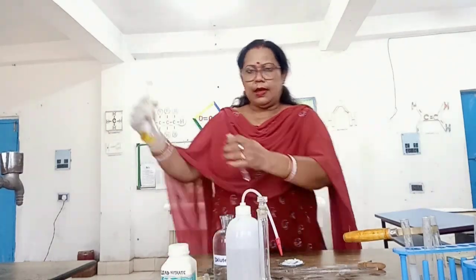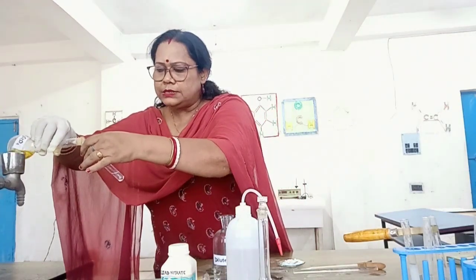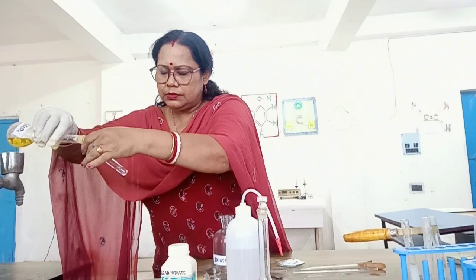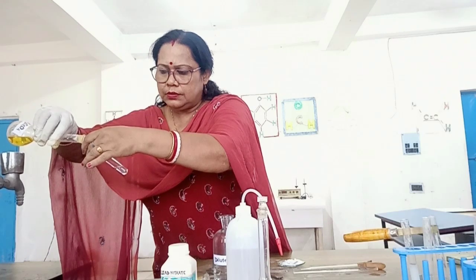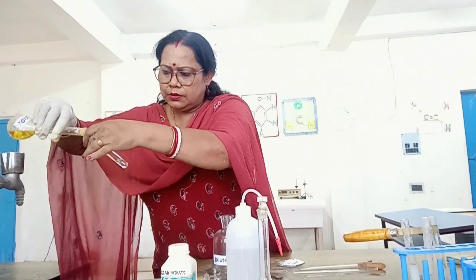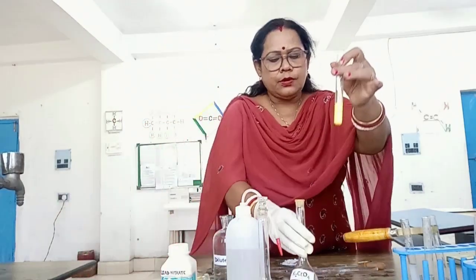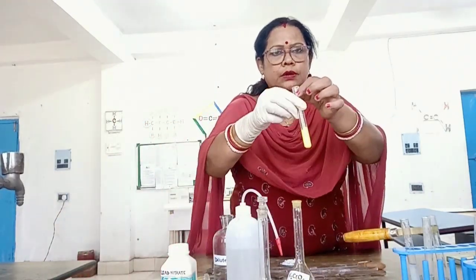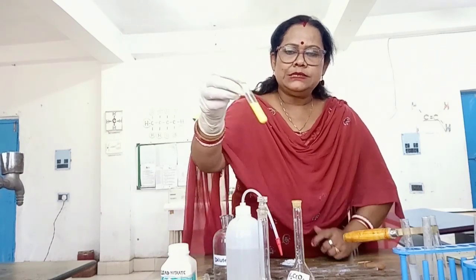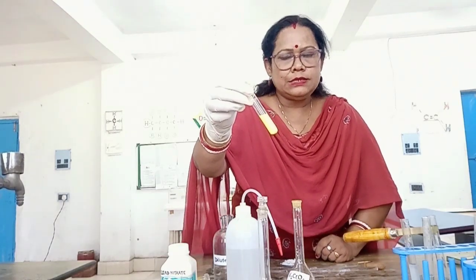Add a few drops of potassium chromate to the second test tube. A yellow precipitate is formed, indicating that lead is present.